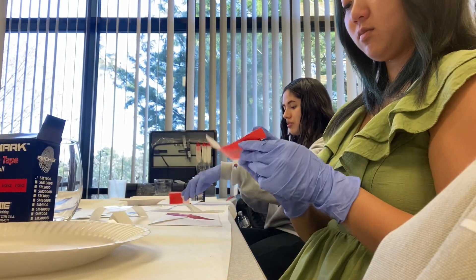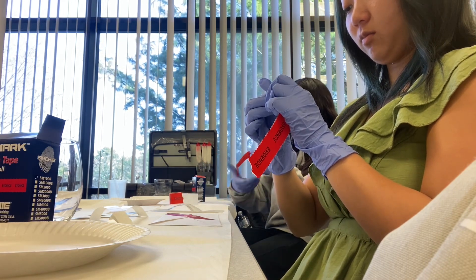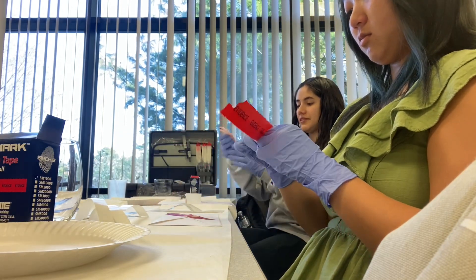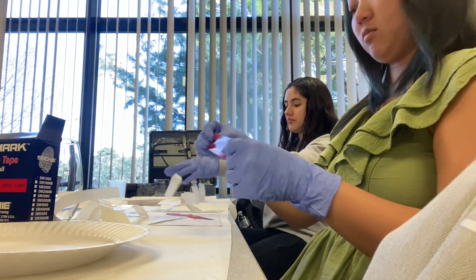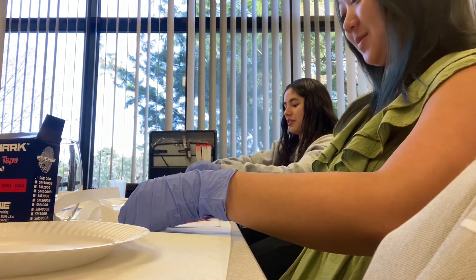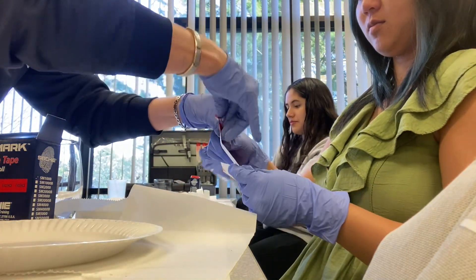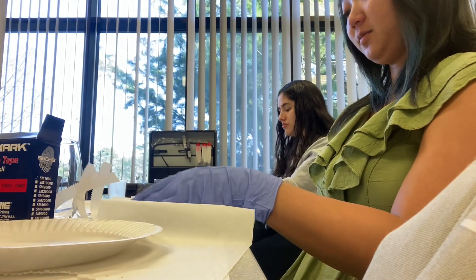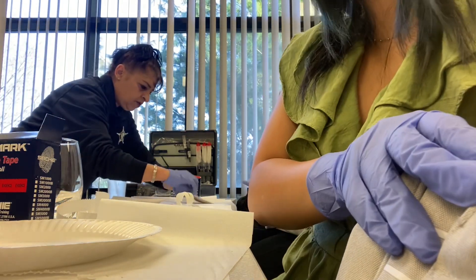It's very difficult — start over. In your V. It's hard with gloves, isn't it? There you go, you got it. And even if you have to use scissors, in your little blue box you have scissors if you need — just use scissors or you can rip them if you want, to make it to the size. Very good, you got it. And you can just wrap that right — you could do it that way or you could tear it off. Like if you had extra, you could tear it off that way. So you want a date and initial. You guys got pens? Okay, so you want a date and initial. You can also use a marker — we use markers, but if you don't have markers you can use a pen.